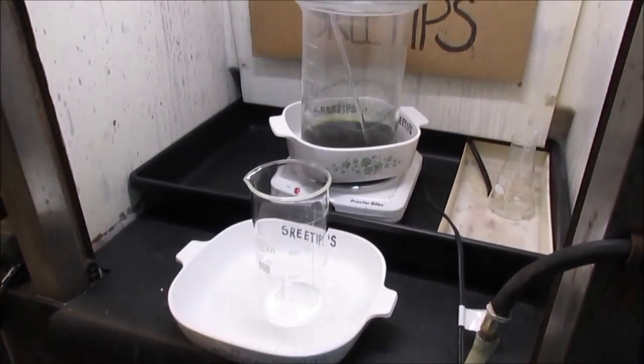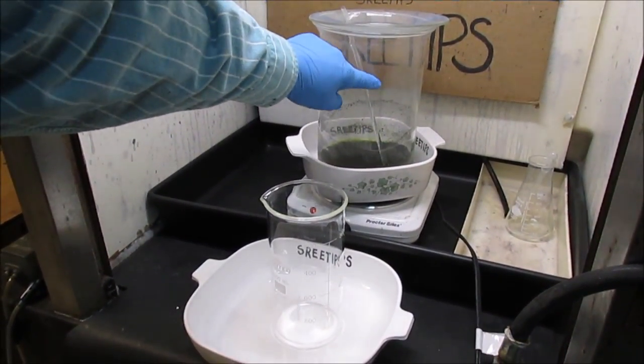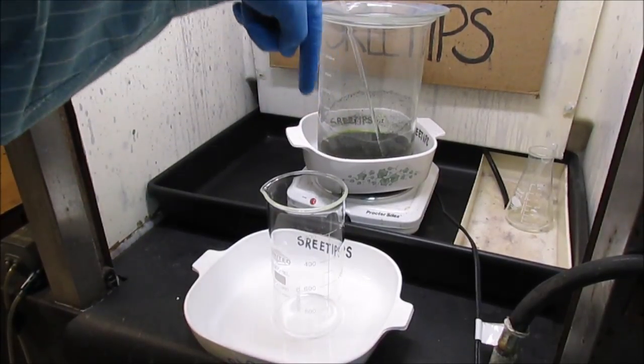But before that happens, I want to transfer the contents. I need this big beaker, so I'm going to transfer this into here.